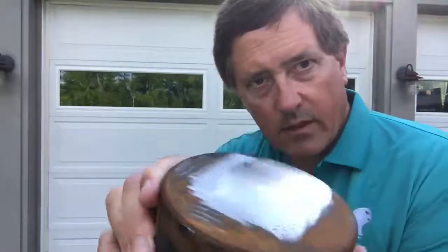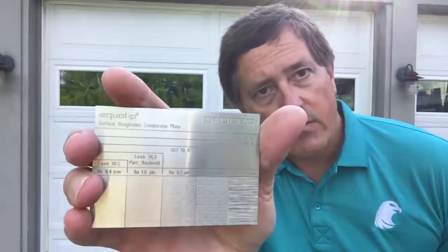So I've done my surface preparation, right? We can see it there, looks good, right? But how do I know that it's the right surface finish? Every probe has a different specification, so I don't carry a surface profile gauge in the field. So we have the next best thing. We have a surface roughness comparator plate.